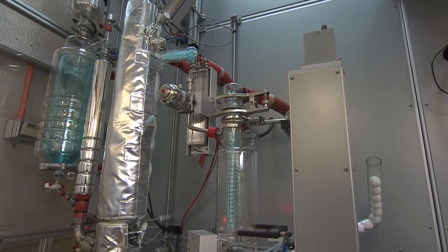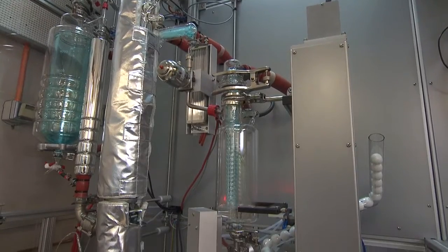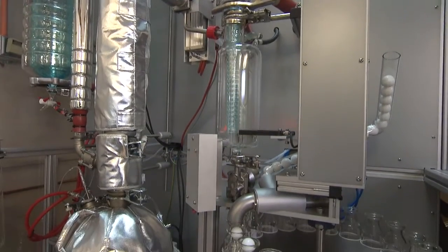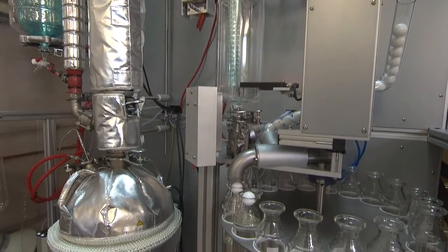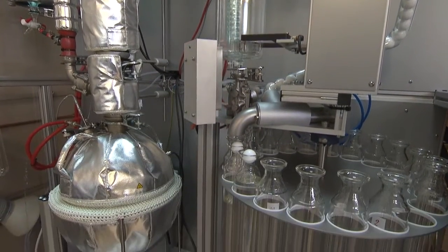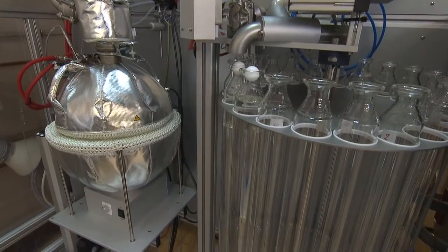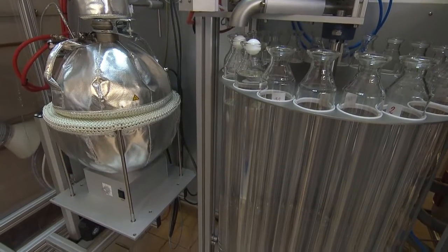The initial phase of an assay involves separating the crude petroleum into a number of defined boiling ranges or cuts through a distillation process.